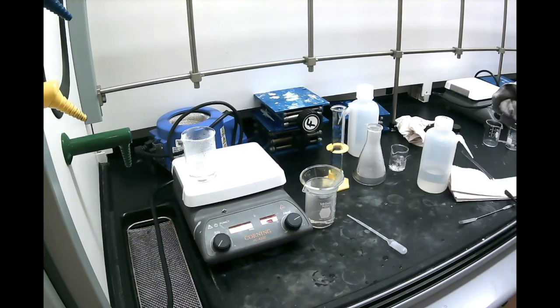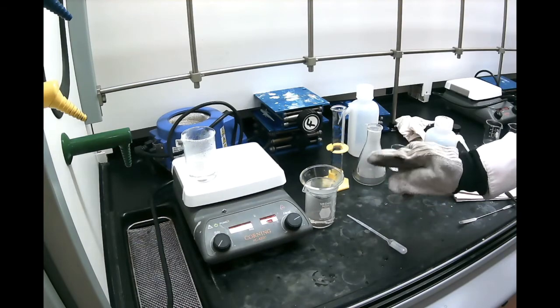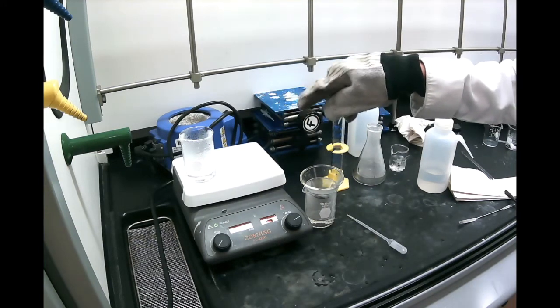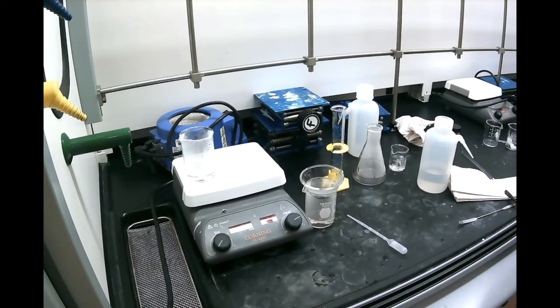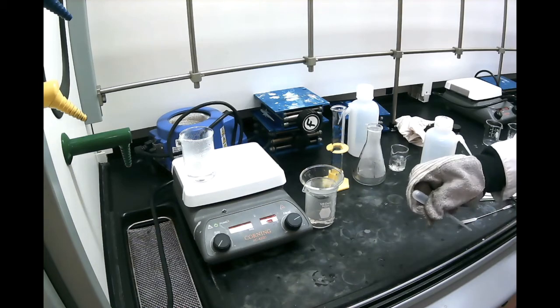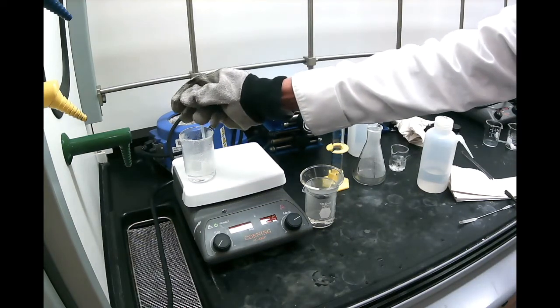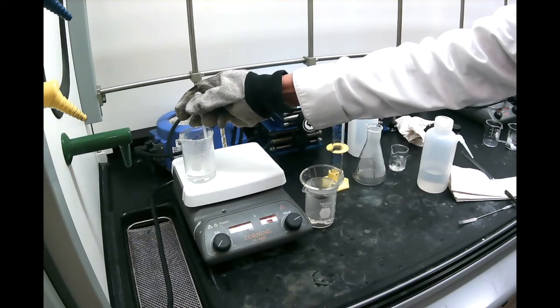So now, what do we do next? Once we finish that filtration, we're going to rinse the funnel one more time, and then since we added a lot more water than we needed, we need to evaporate it again. That's also another aspect of recrystallization that's like an art. You have to let it evaporate, and then the question is, how far should I keep going? And we're going to show you how this should work.